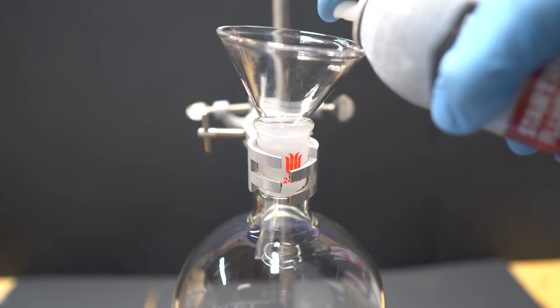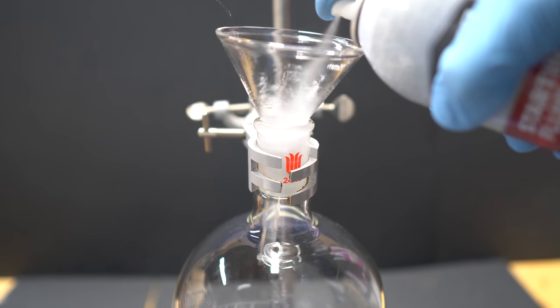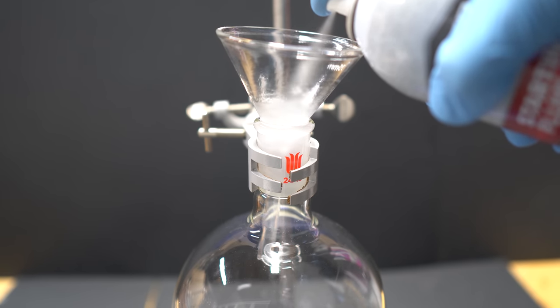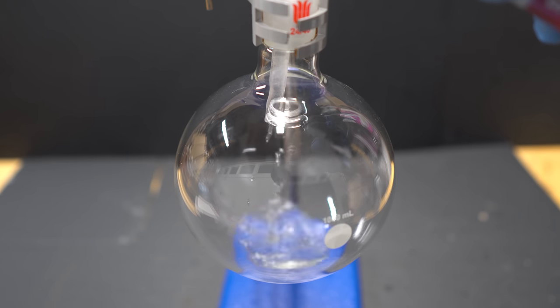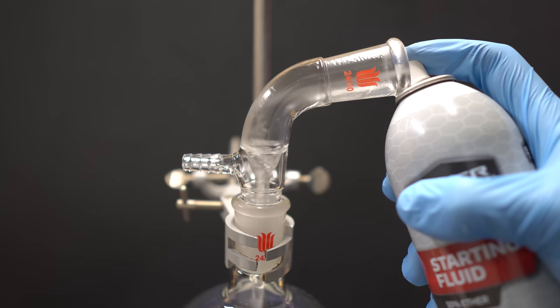Initially we're going to put everything into a round bottom boiling flask because we are going to distill all the ether and heptane over. I start off by using a funnel but this turned out to be quite a bad idea as there was a lot lost when I kept spraying.